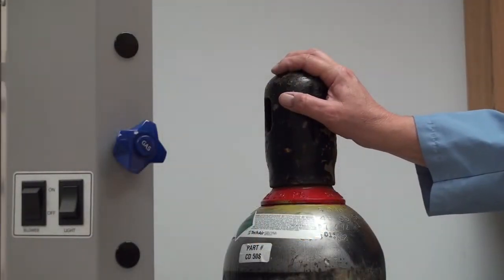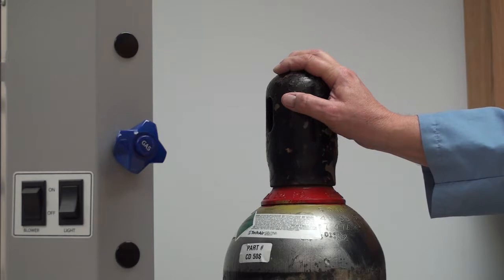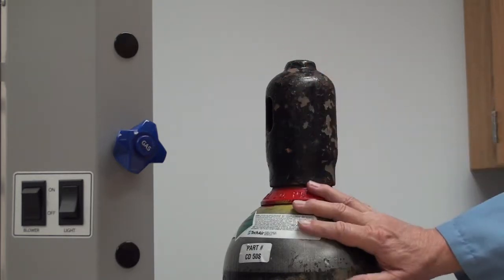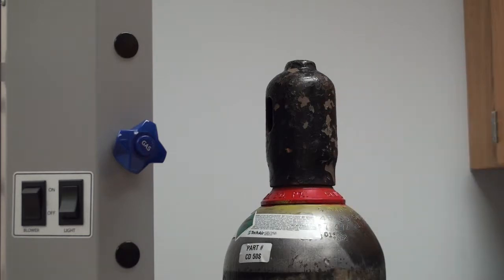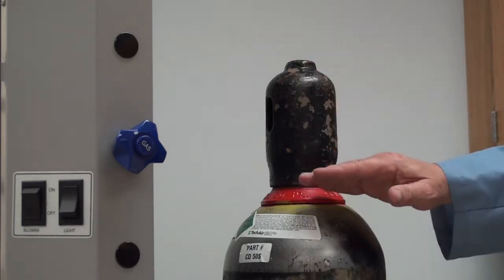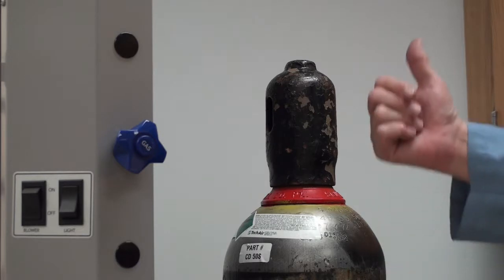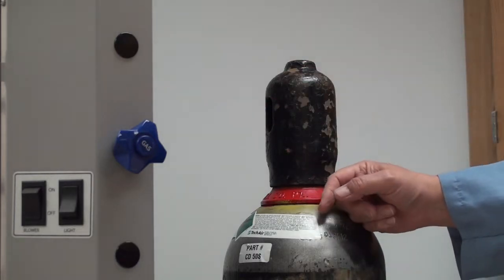Here is the CO2 tank that you obtain from your local gas distributor. It is a special type of tank with a siphon tube or also known as a dip tube. Since you want to transfer liquid CO2 from the tank to the CPD, you need this special tank. Otherwise, when you open the valve it is just taking gas from the top going down. The siphon tube goes all the way to the bottom of the tank and takes liquid CO2 and delivers it to the CPD.